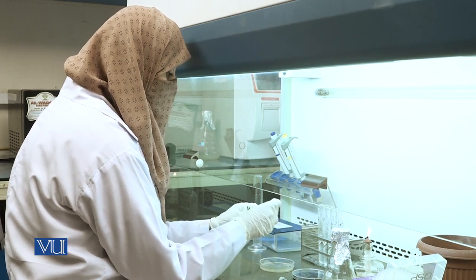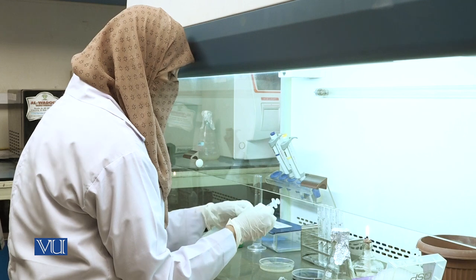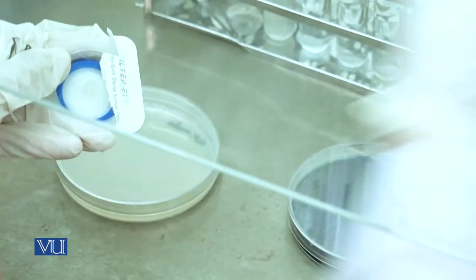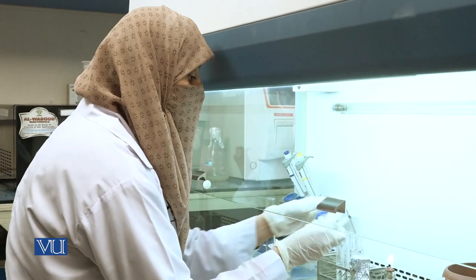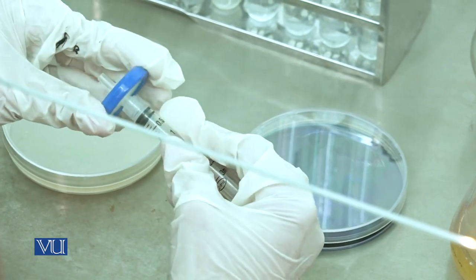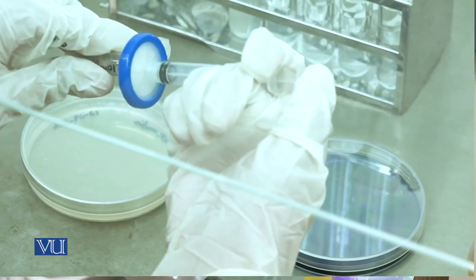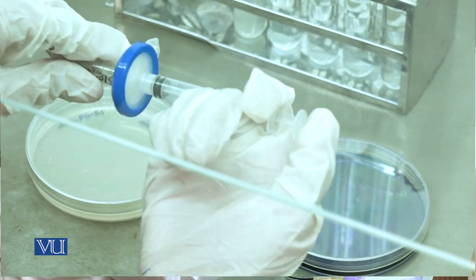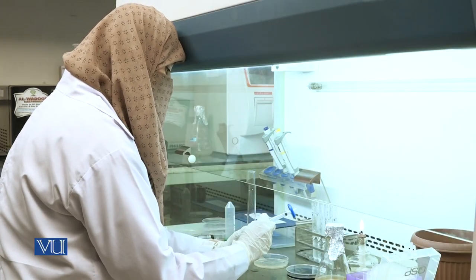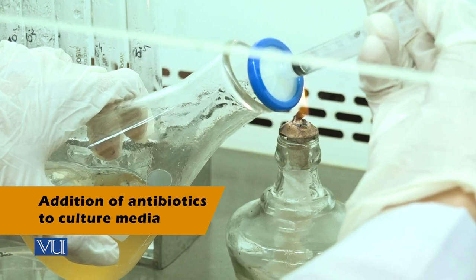We use a syringe filter for antibiotic addition. This is the syringe filter — place the syringe filter and adjust it on the syringe. Now take the antibiotic and add antibiotic solution to the media.